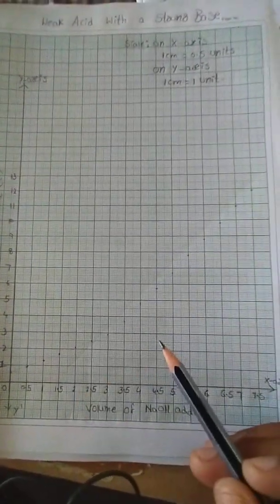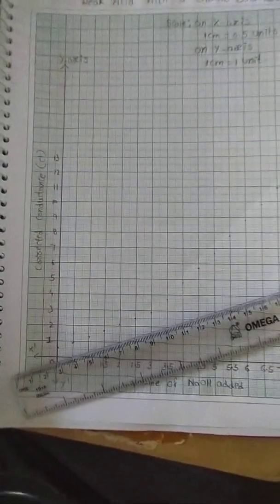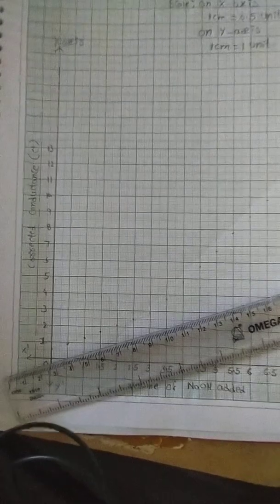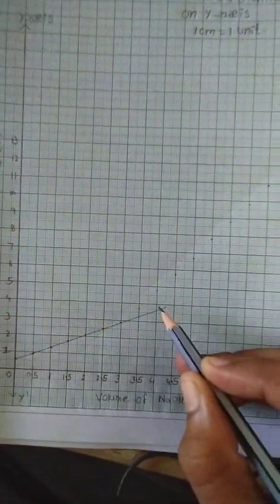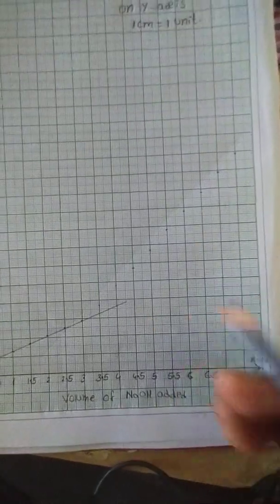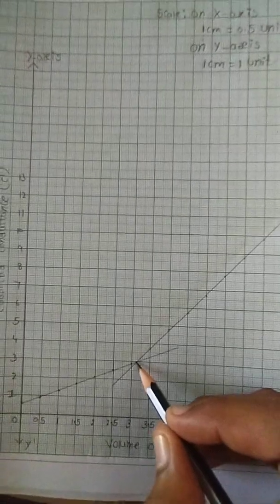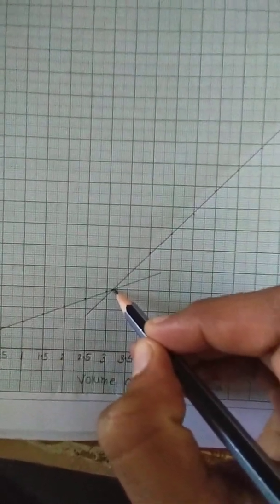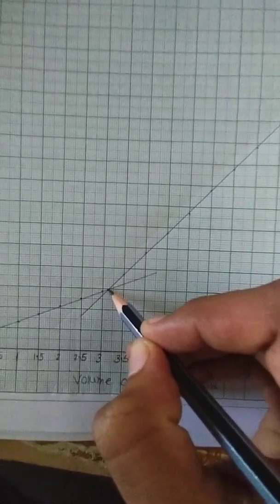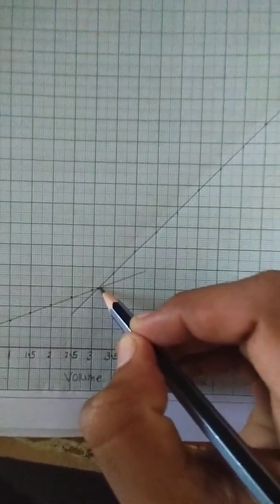After plotting all the values on the graph, we have to join the points with the help of a scale. While joining the points, we have to make sure that most of the points lie on the line. After joining all the points, we will observe that two straight lines are meeting at a point. This point of intersection gives the end point for the conductometric titration of a weak acid with strong base.